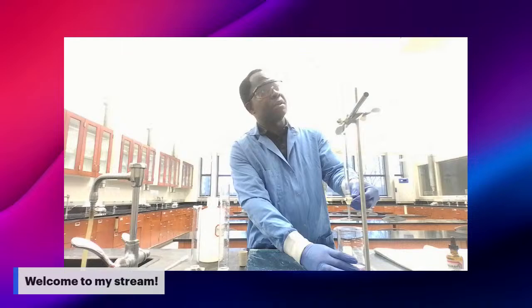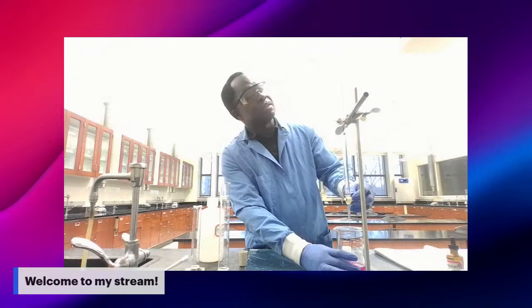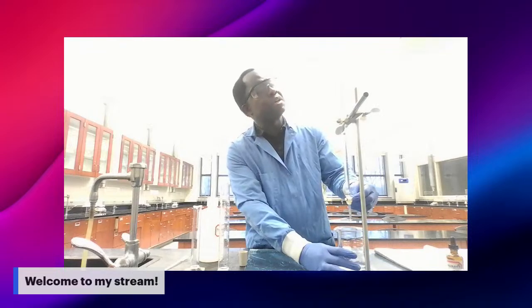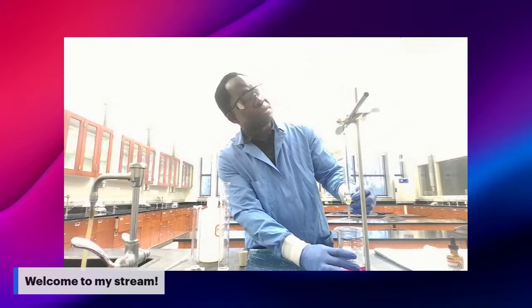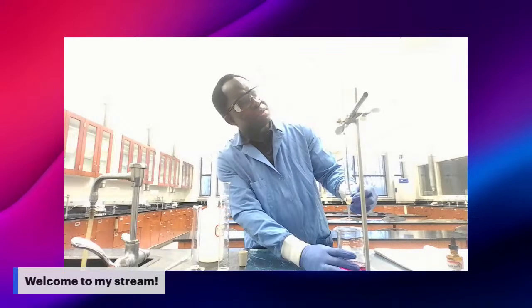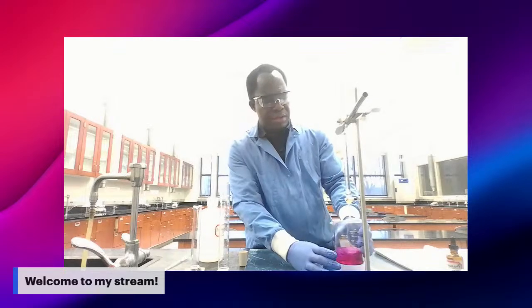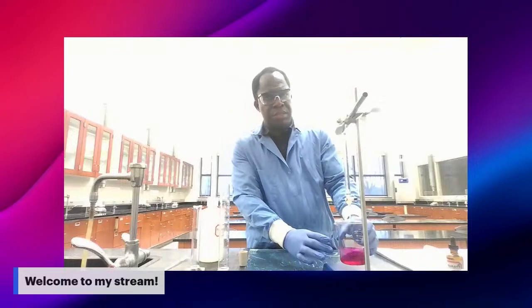Just to show you the steps until you actually get to the equivalence. This is what I get.